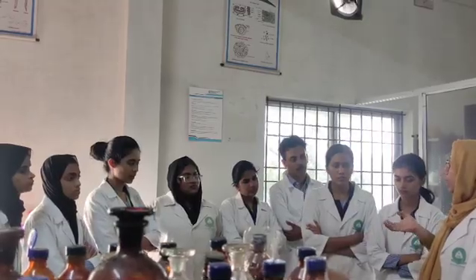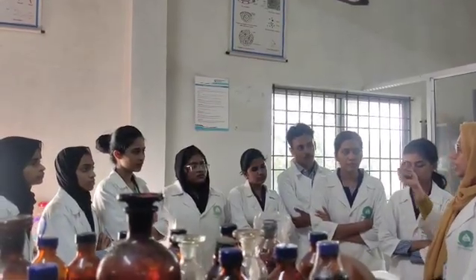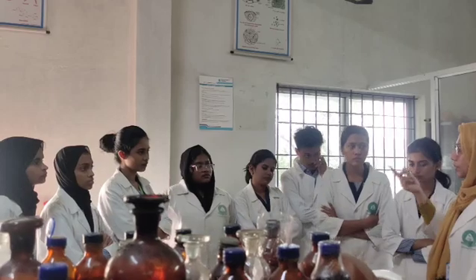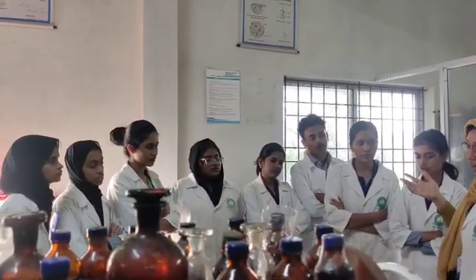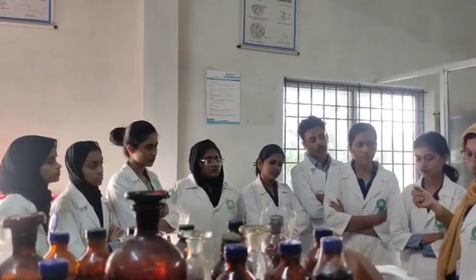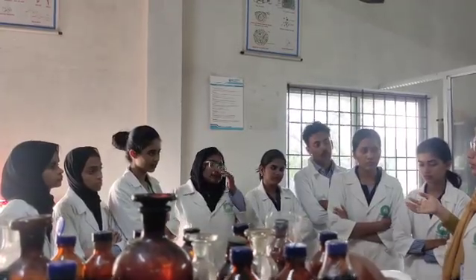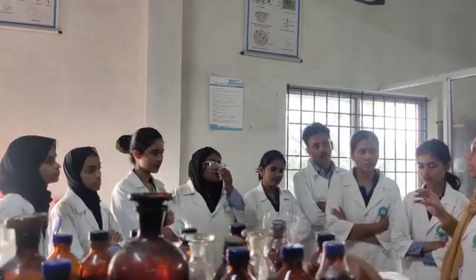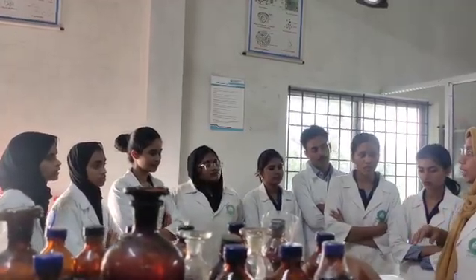And next we go for the tests for agar. Specifically we have the test for carbohydrate, and first we do the gelling property. Then what is the last test we have mentioned? The test for the absence of gelatin. For that we have to treat it with tannic acid, which indicates the absence of gelatin and confirms the presence of agar.